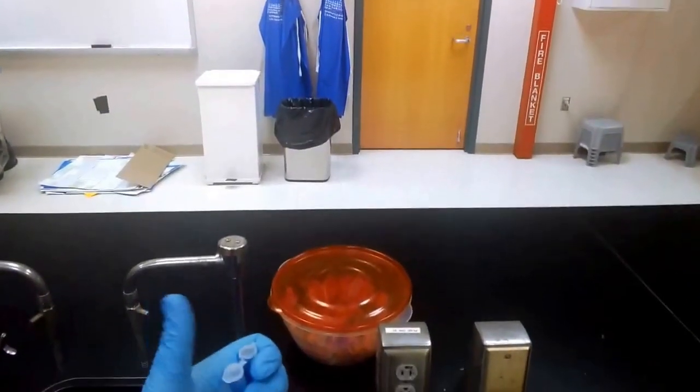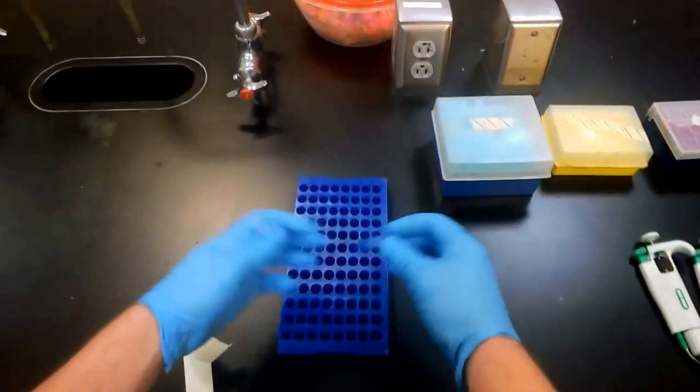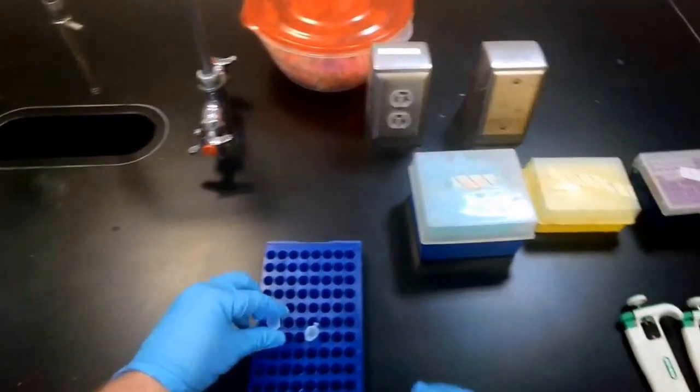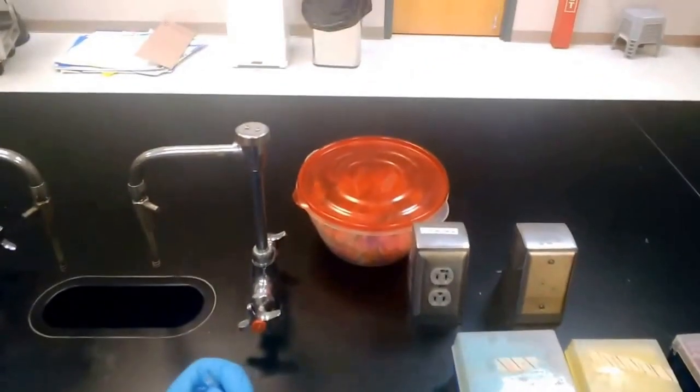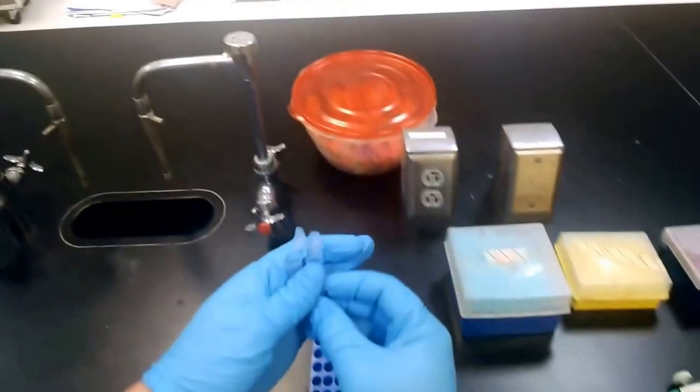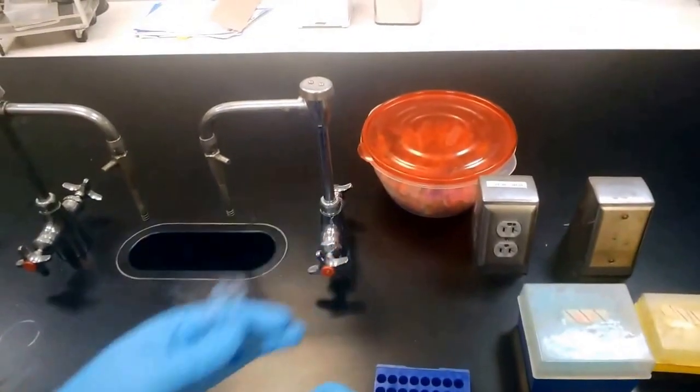Now this is a little bit tricky, so it's okay if you use a test tube rack. So you want to be able to open two of them, and that way we can transfer solutions from one to another.